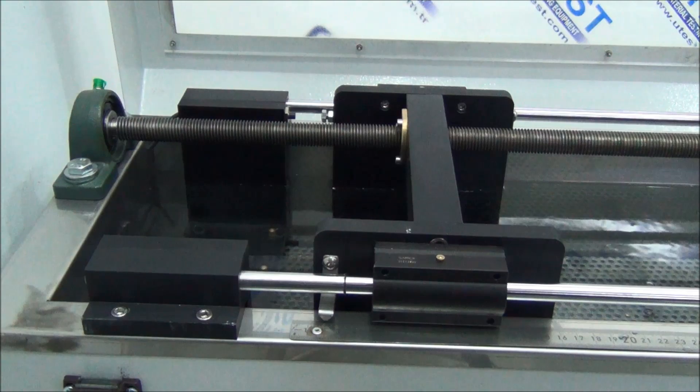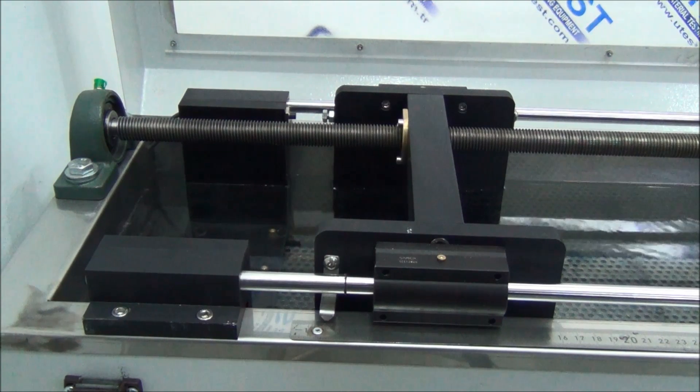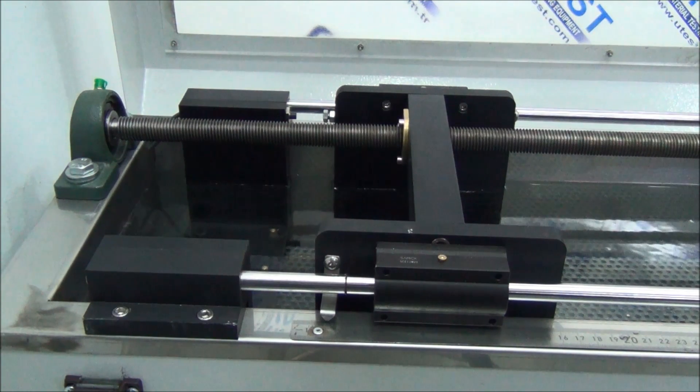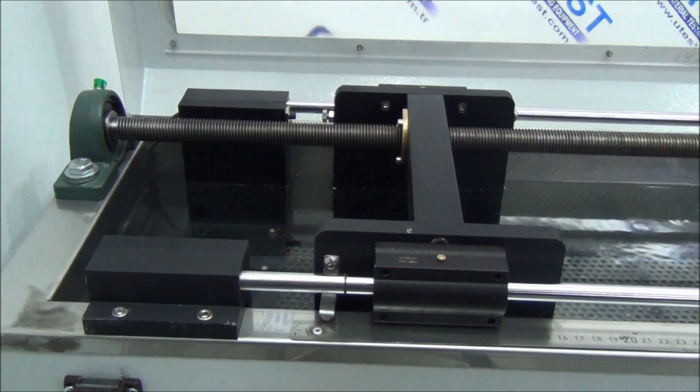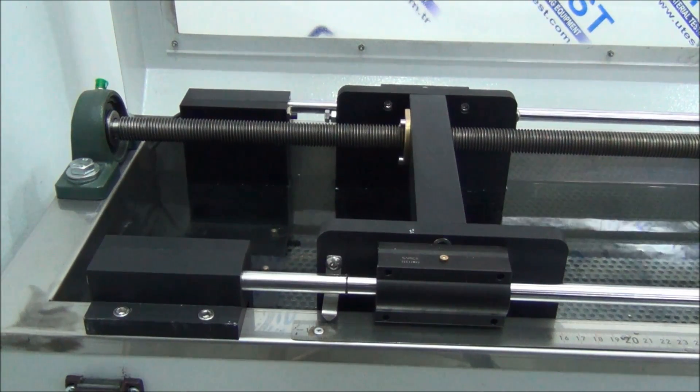Record starting position. Run the device and record each sample failure in centimeters.